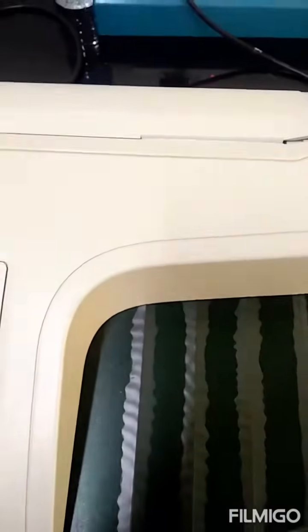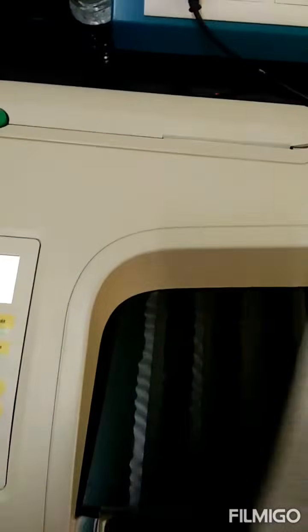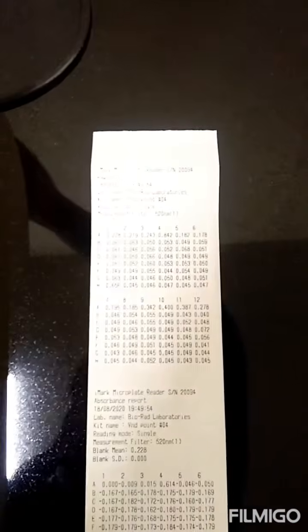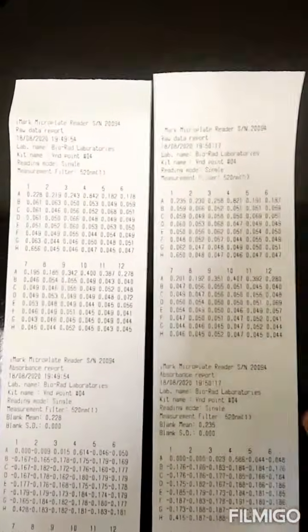Since I'm going to do it in triplicates, I'm going to take another reading. A very important thing that I want to tell you is, whenever you're using such sheets, make a photocopy of this or write the values in some other sheet, because after a few days the ink will go off and you can't read the values. So I'm getting my second absorbance also, and once more I'm going to take, that is the triplicate. As I was saying, this ink will disappear after a few days or few months. If you're not maintaining it properly, take an immediate photocopy or write down these values in some book manually. After 2-3 months, if you search for the values, you can't see all these things. Everything would have disappeared.